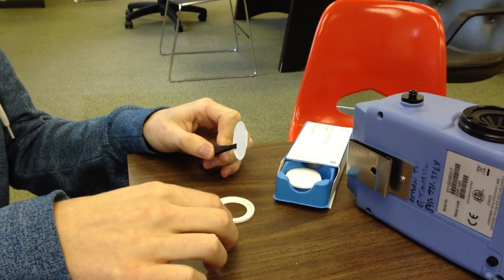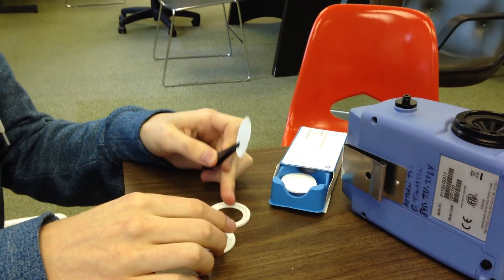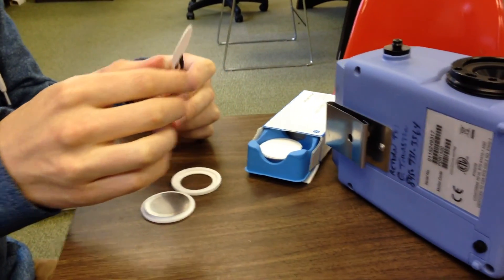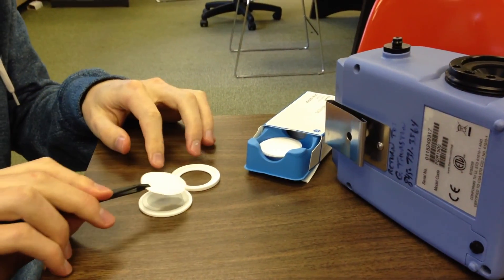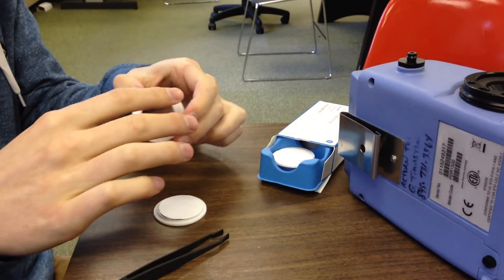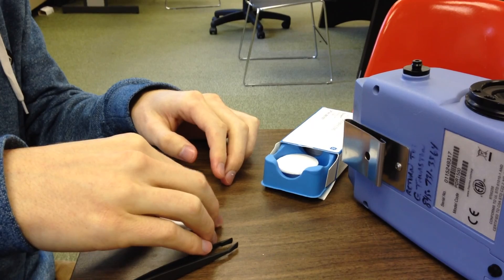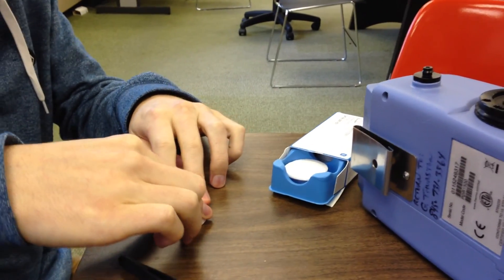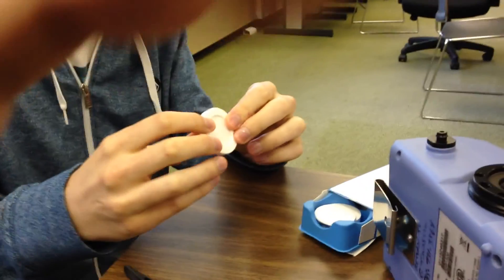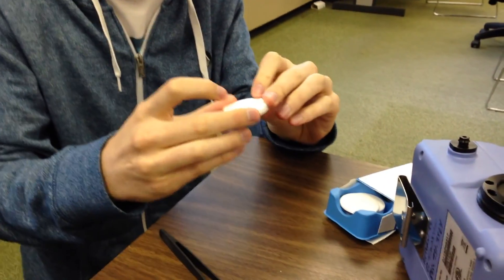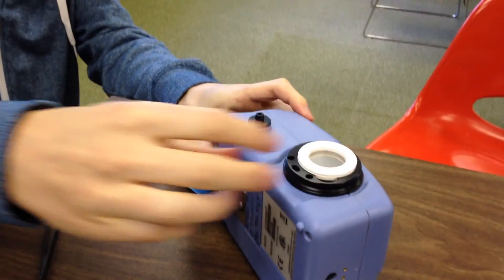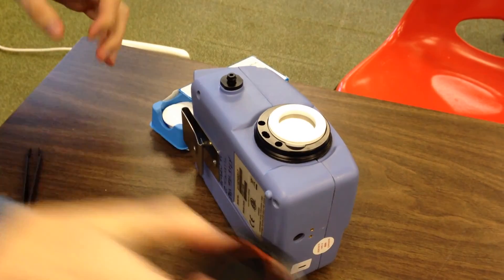Place a new glass fiber filter into the filter holder using tweezers. Make sure that the filter holder is tightly sealed on both ends. Then place the holder back into the side of the PDR and screw the cap back on.